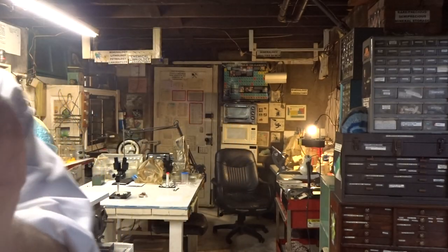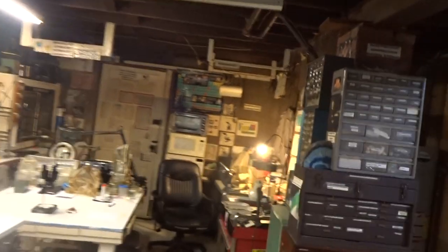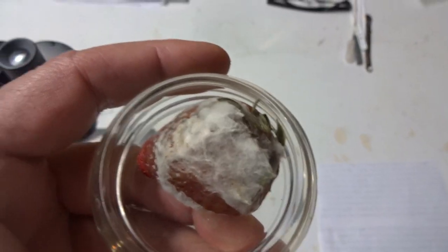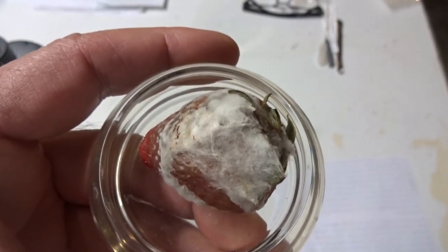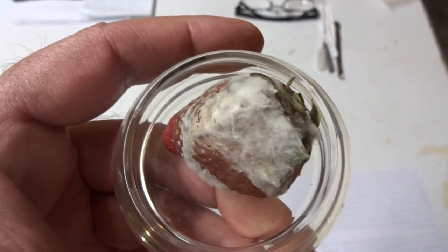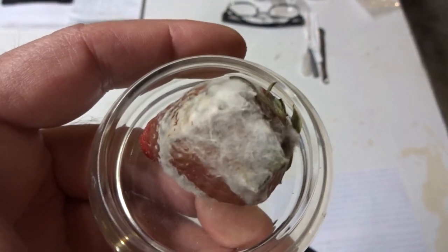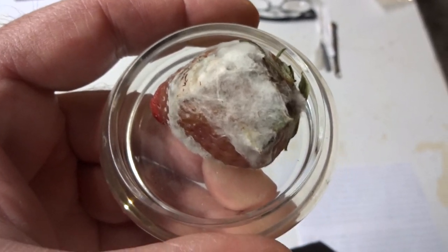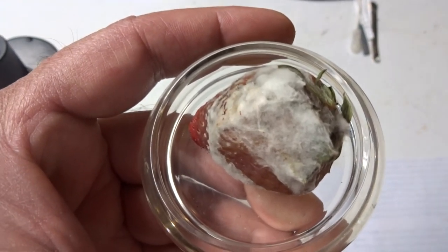Let's get to the demonstration. Here is the moldy strawberry we will be looking at. The white substance that you see on it is called mycelium. It consists of hyphae that have branched into mycelia. Let's look at it under the stereomicroscope.